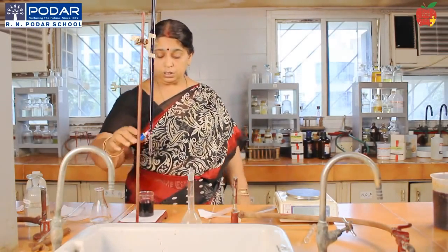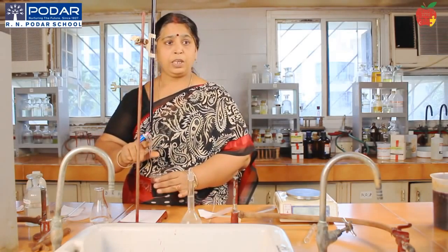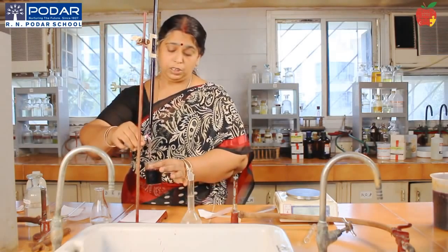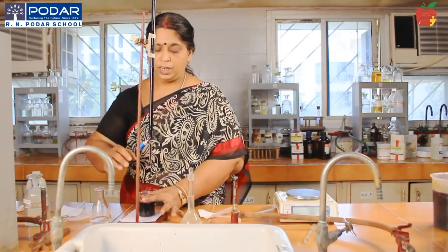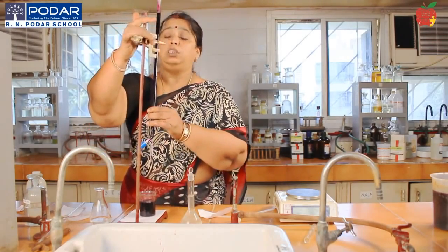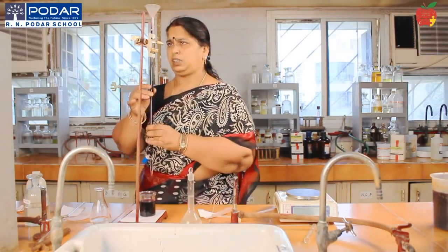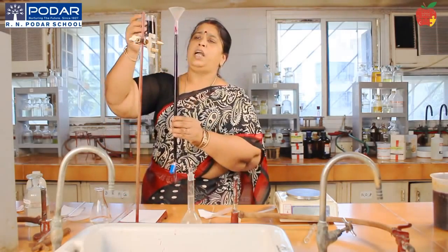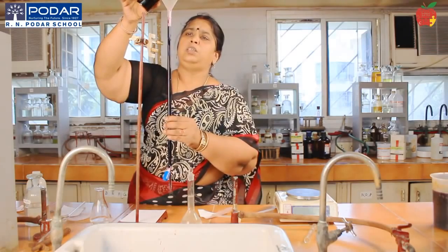So now keep your beaker here and see, it is not filled now. Okay. I am taking care to fill up that. How? By taking it above the 0 mark. I just open and now the nozzle portion is filled, and then I check for the 0 reading in the burette. It is slightly less, I believe, right? So let me add some more and now make it up to the 0 mark.